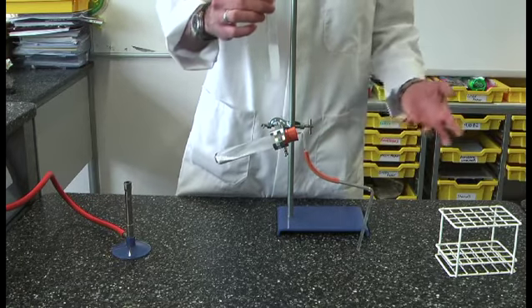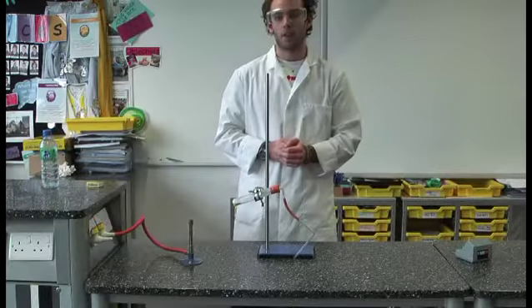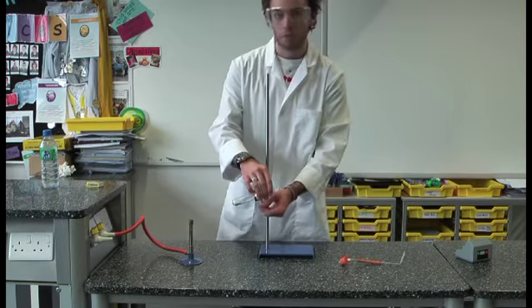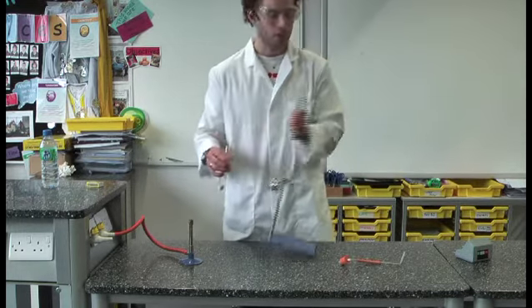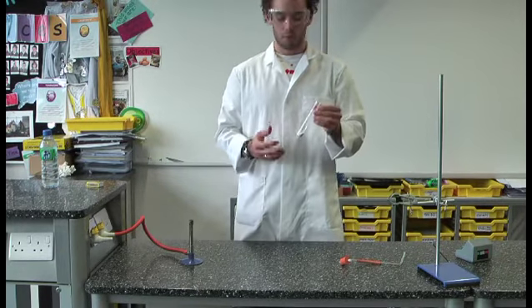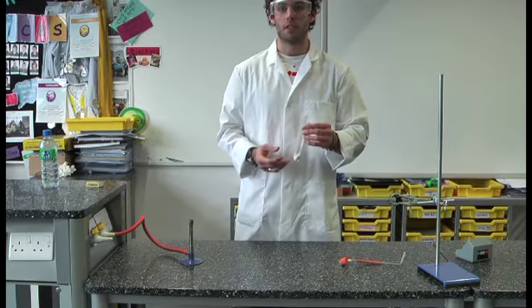That demonstrates to us that CO2 was produced. Having been given time to cool, we can now remove the delivery tube from the boiling tube, remove the boiling tube from the clamp and using our mass balance once again, we can weigh this delivery tube with the product of thermal decomposition inside.